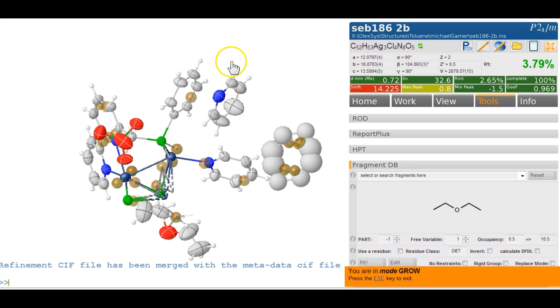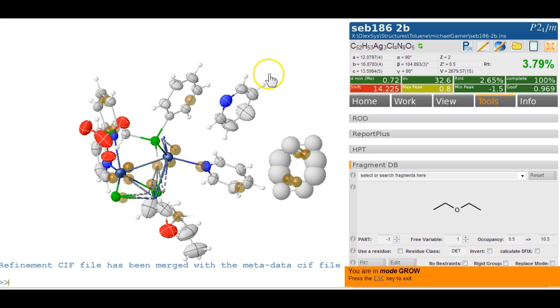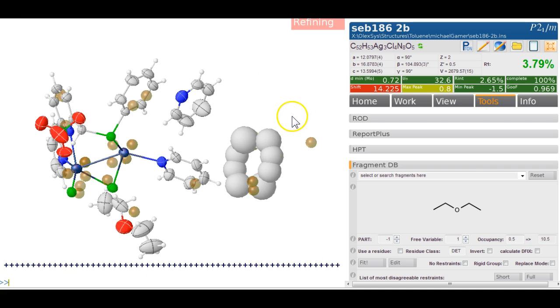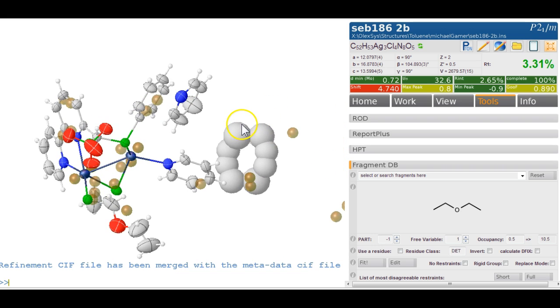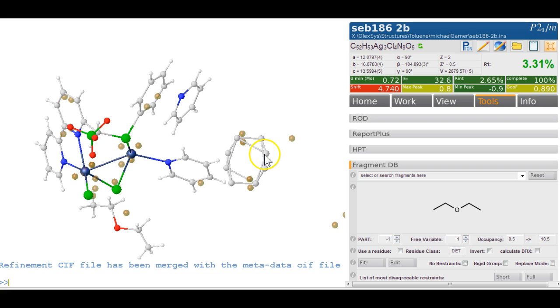Okay, so that really does start looking like a 6-membered ring and some sort of disordered arrangement. Let's refine this again, see whether anything moves, but majorly here. So yeah, there's a bit of a mess. The way you would deal with this in Olex2 is pick out a set that could make some sort of sense first to go into that mode.